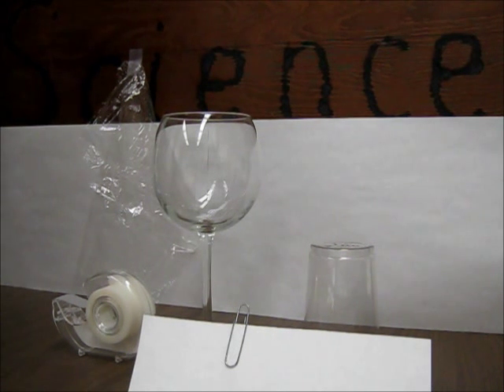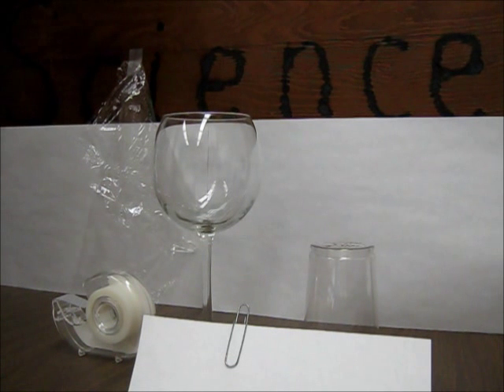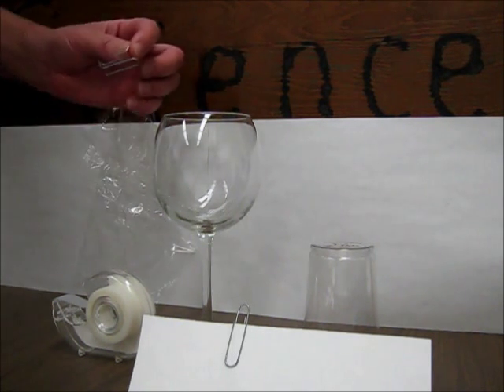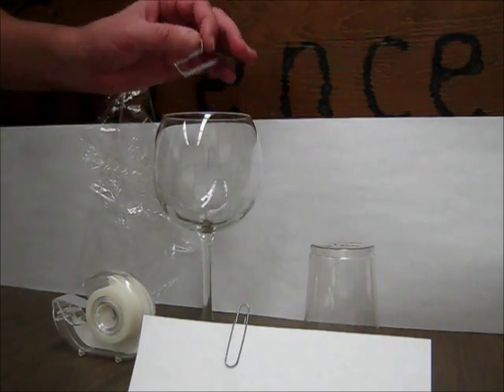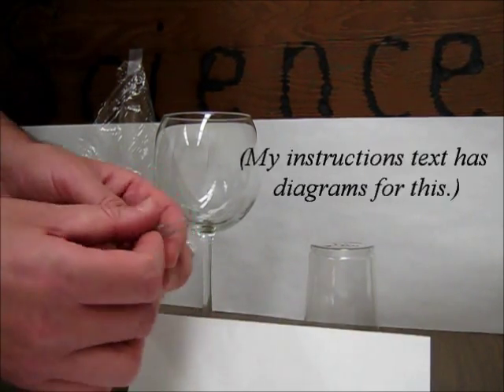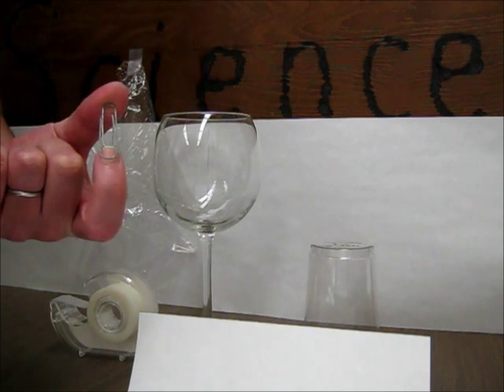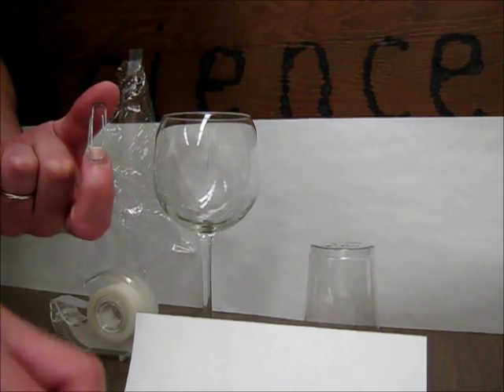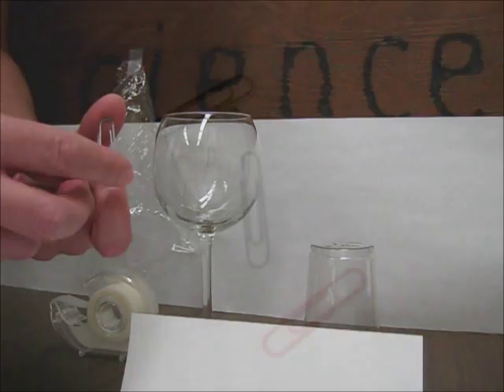The paper clip is going to have two functions. First of all, it's going to be the electrical connection between outside and in the glass where the foil is hanging, electrical connection to the foil. The other function is it serves to hang the foil from mechanically and also to hang itself. So it's going to sit about like that in the glass, which is why I need a cover, part of why I need a cover. And I'll show you how I bent this to do that. Once you figure it out, it's a fairly simple series of bends. First, I take my paper clip, and I've got to have chosen one that's big enough to work with. So little metal ones are okay, but they're a little harder to work with. Plastic ones are not okay, because I need an electrical connection.